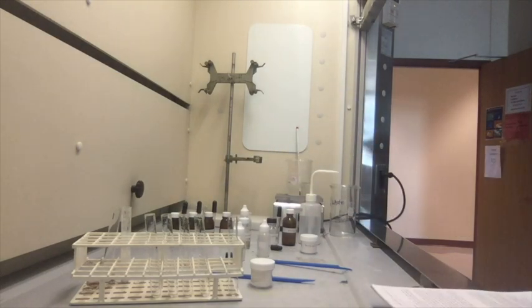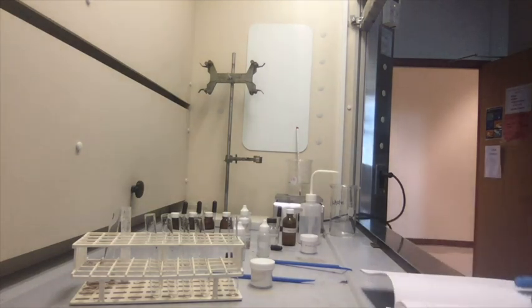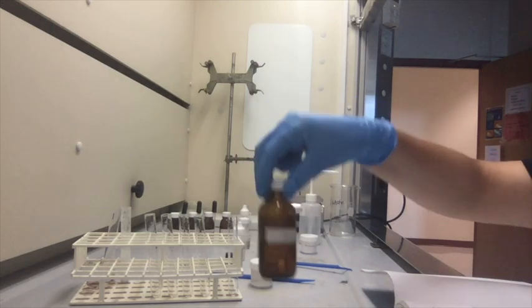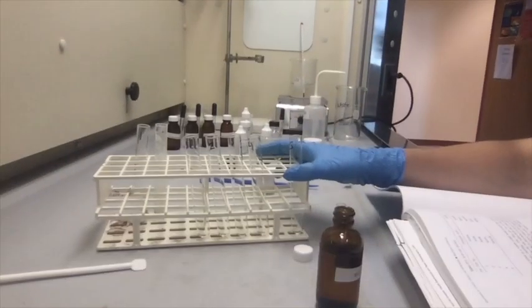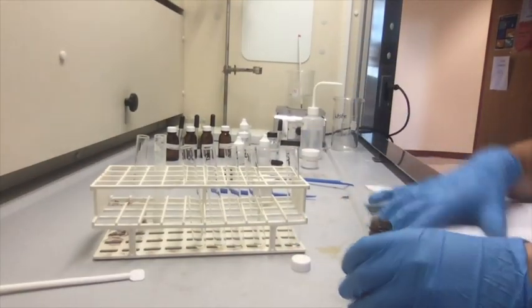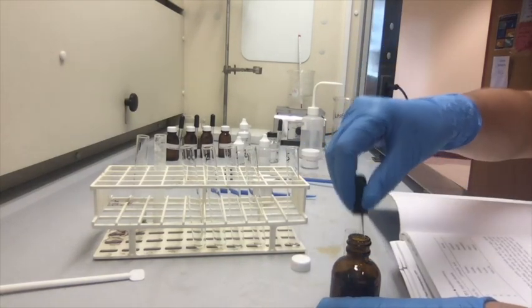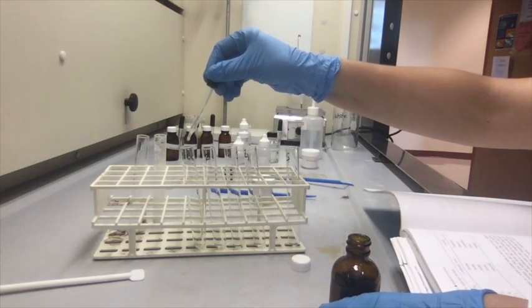So now I'm going to add 10 drops of the liquid carboxylic acid and 10 drops of alcohol according to the scheme in table 27.1. So test tube 1, I'm going to add formic acid and isobutanol, so 10 drops and 10 drops. I've got my 80% formic acid. Tube number 1. I'm going to bring this a little closer so you guys can see better. Need a dropper. So 1, 2. There we go.